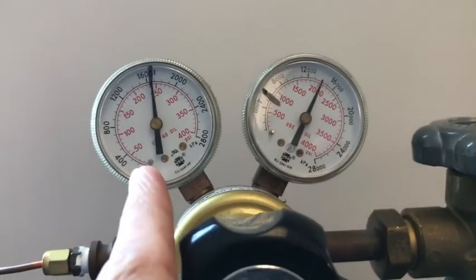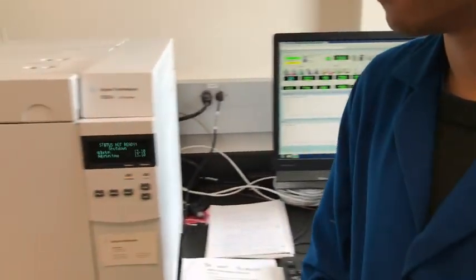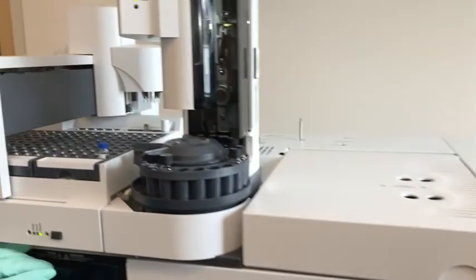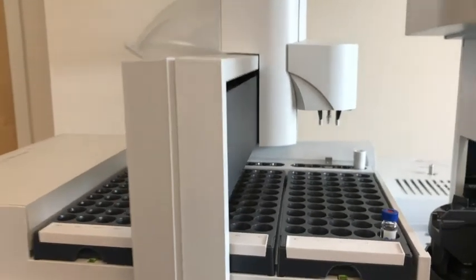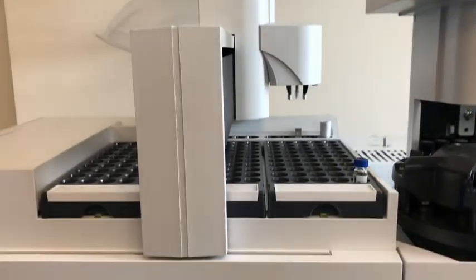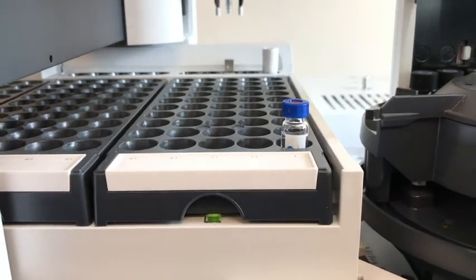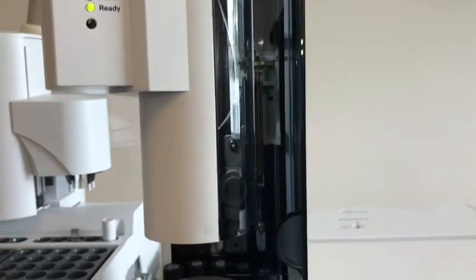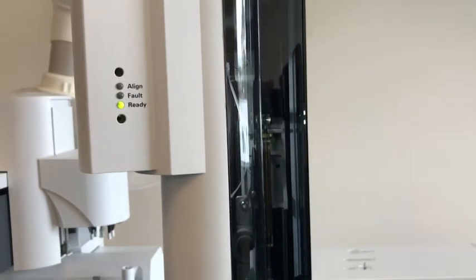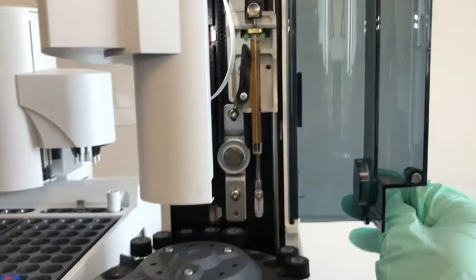This is the GC mass spec instrument — there are many components to it. The first part on the top is the auto sampler, and we have put one of our reference samples there. This is the injector port; it's automatic, and that's where the syringe is for the injector.